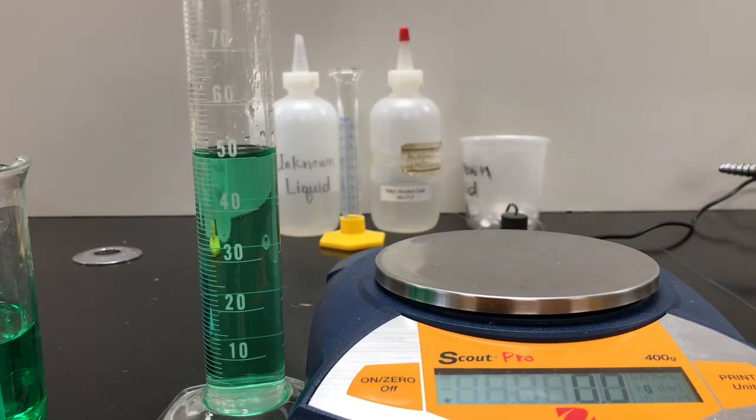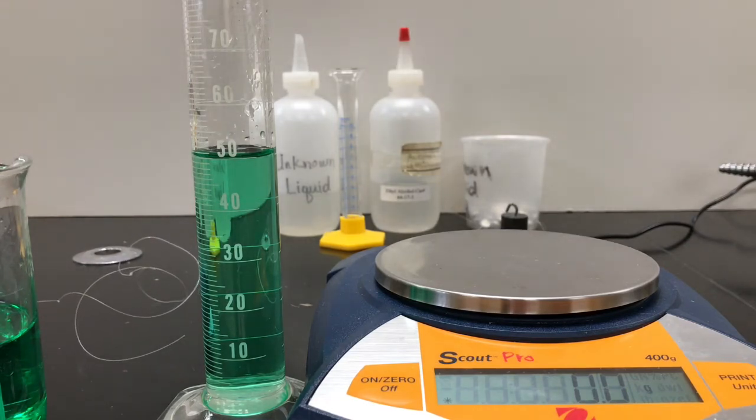You can actually look back in the other materials in the video and ask yourself, did you want to make it a whole number? Or did you want to make it maybe a decimal in between the numbers for values? All of your values should have a tenths place. So we start at 50.0, and if you went up to the volume earlier of close to 70, you don't just put 70, you put 70.0. Or if you thought it was 69, you'd put 69.0. Or if you thought it was in between, maybe you say 69.5. So you're going to rewind the video and alter your readings just a little bit to tune it in just a little bit more.